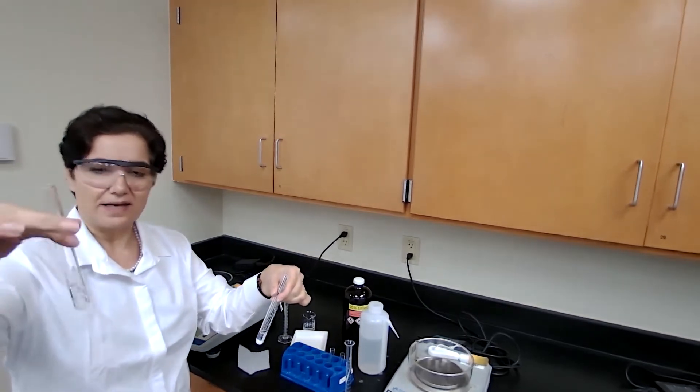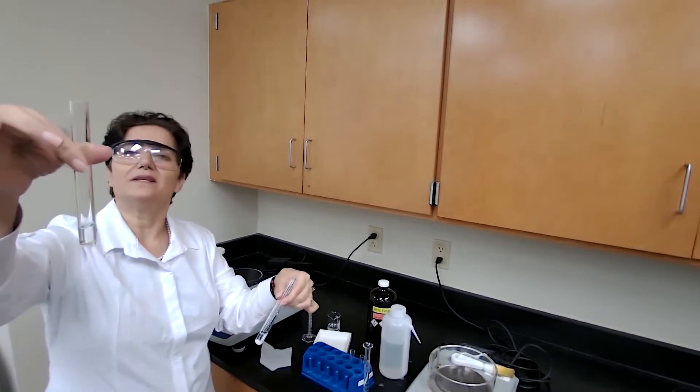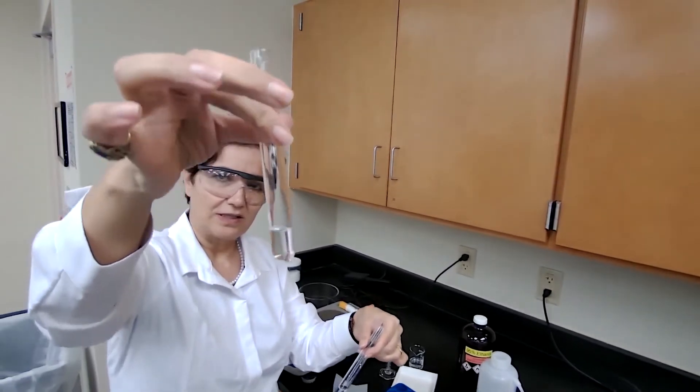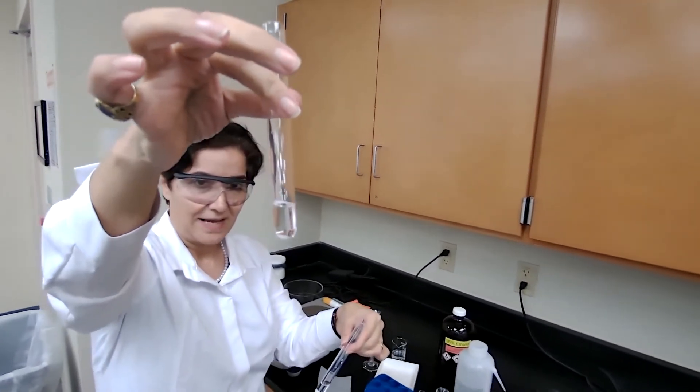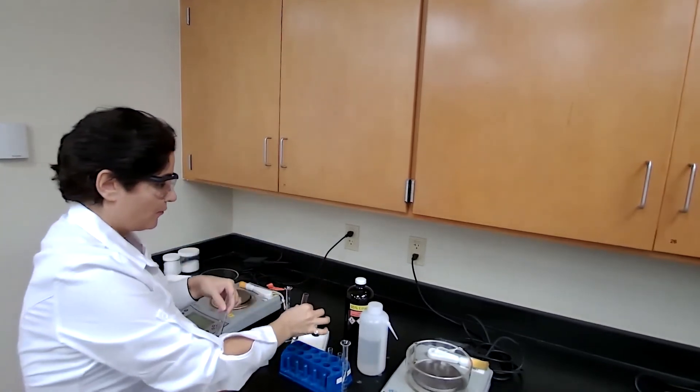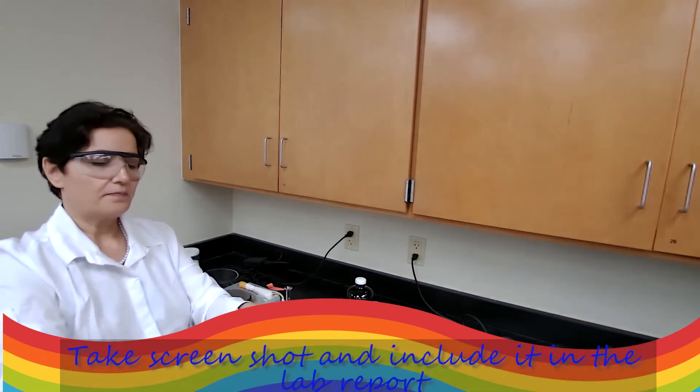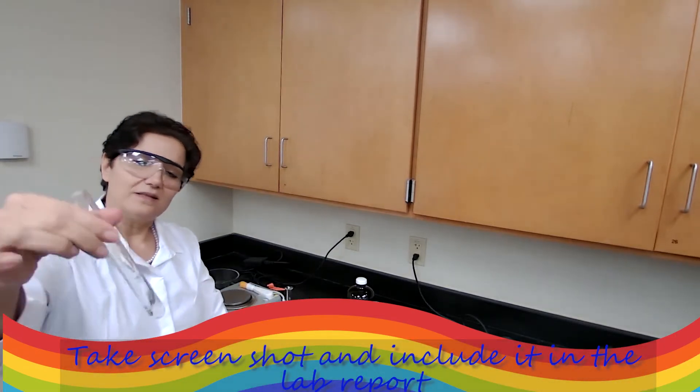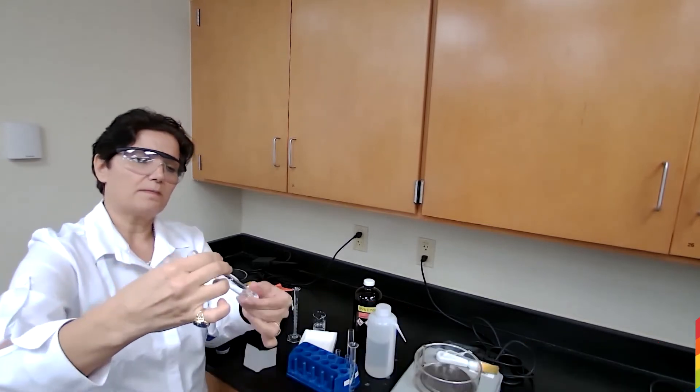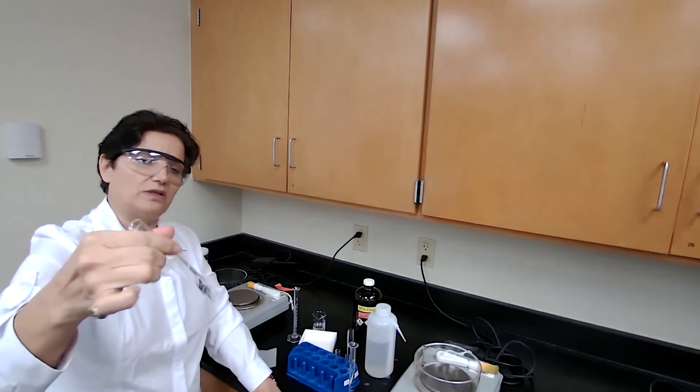The right-hand side is the ethanol, which did dissolve the sample at room temperature. The first condition was not met - ethanol is not a good solvent, so we can't use it. For water, it did not dissolve at room temperature, so the first condition is met.